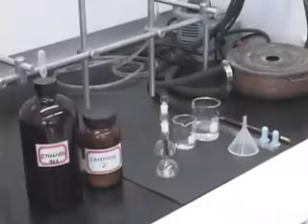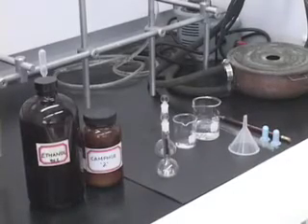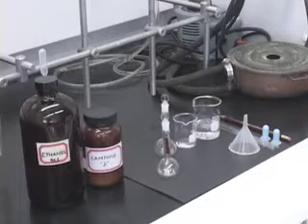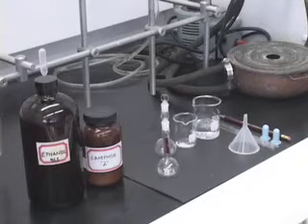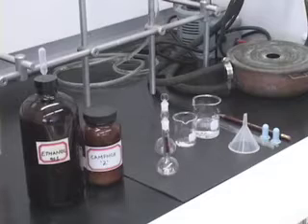In the reduction of camphor experiment, we have to prepare the solutions of both camphor and the product to a known concentration before we can determine the specific rotation of these two compounds. I'm going to show you how to prepare solutions of exactly known concentration.